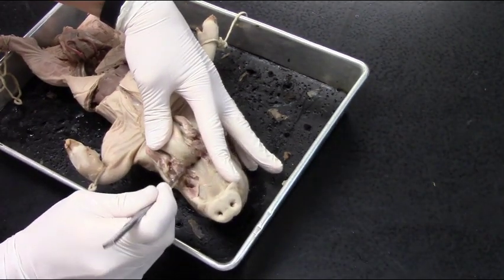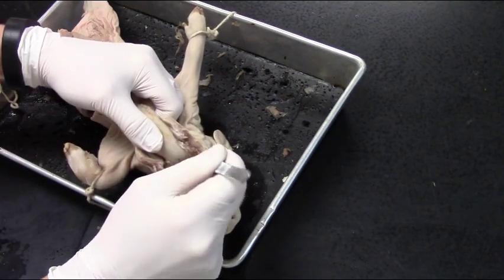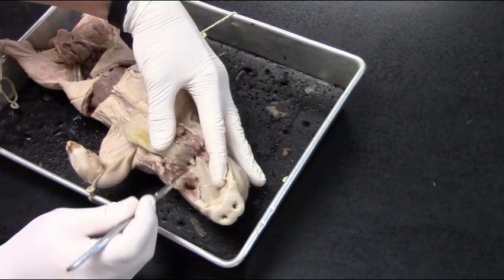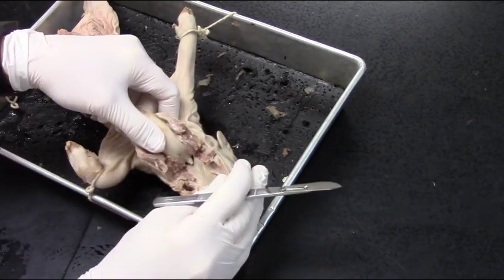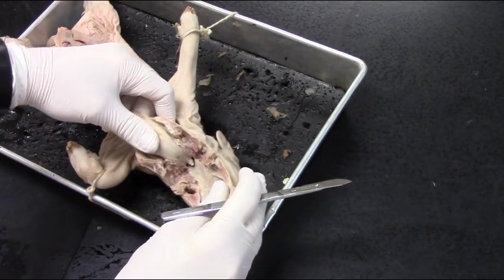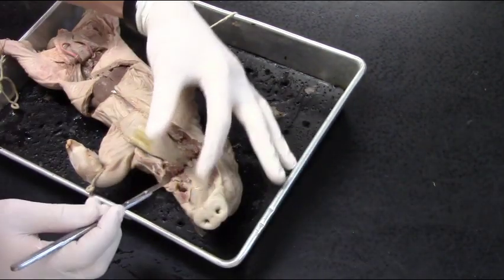Continuing to make those slight incisions, I can just start to see the epiglottis right now, which means I'm getting close. Just loosening on either side. There's the epiglottis—I'm almost there. I'm not cutting into the roof of the mouth or the tongue, just opening up the muscles. With a little bit more incision, I should be right there.